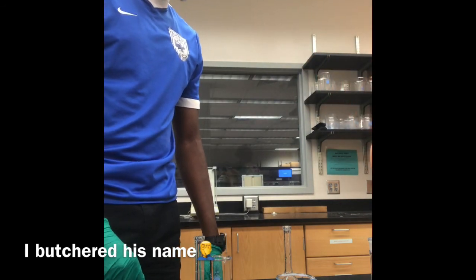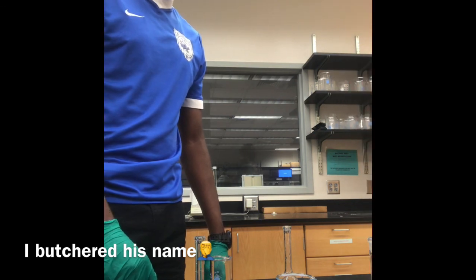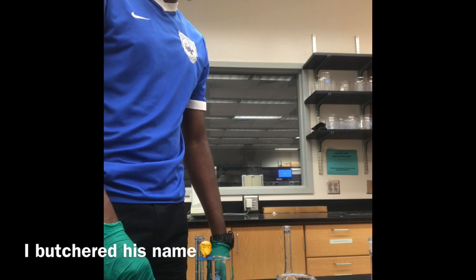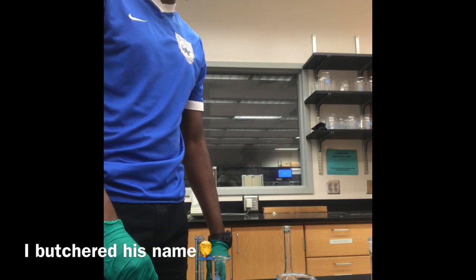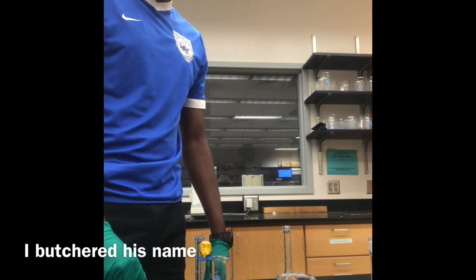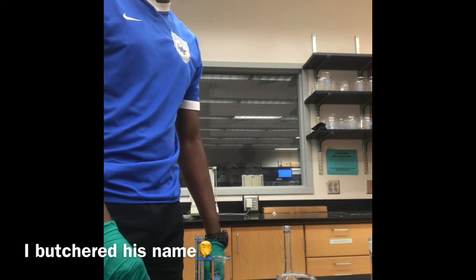And at the end of 4 solutions, you would then use all of these in the spectrometer to determine their absorbance. With their absorbance, you'll be able to determine the molarity of the unknown solution, because for the 4 solutions you know the molarity and their absorbance. And then you use a graph to determine that. He's explaining all this to me.